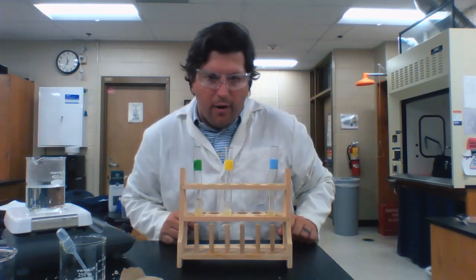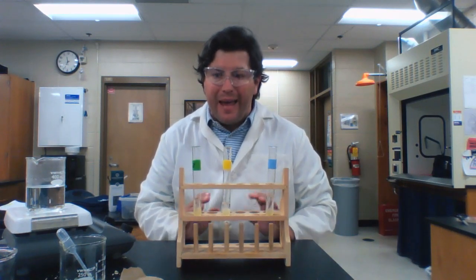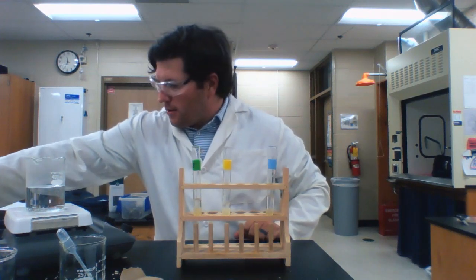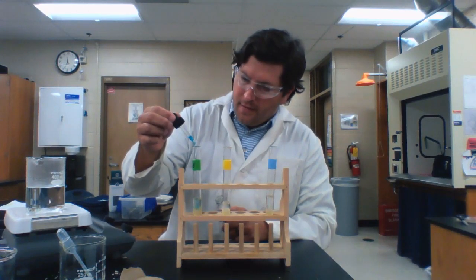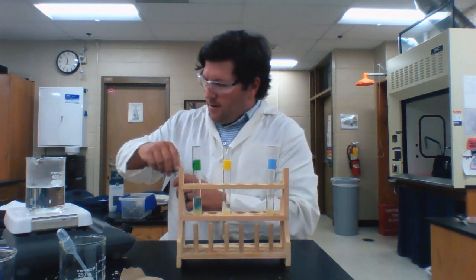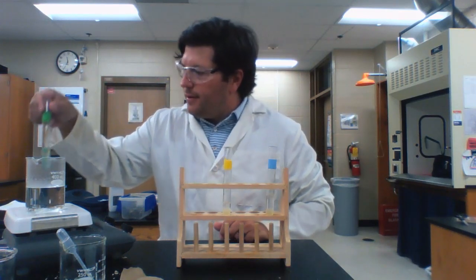All right, so here we go with our last food item. Again, we're going to do each of those same 4 tests that we've been doing all along. So now I'm looking at egg whites, and the first test I'm going to do is for our glucose using Benedict solution. So 15 drops of Benedict solution. And we're going to let that hang out in our warm water bath.